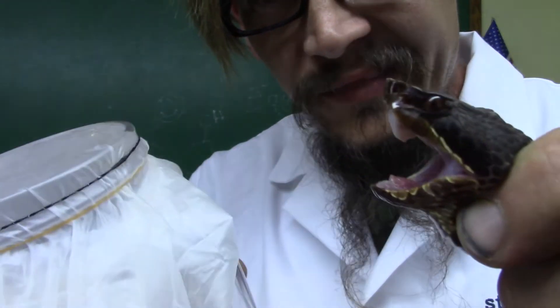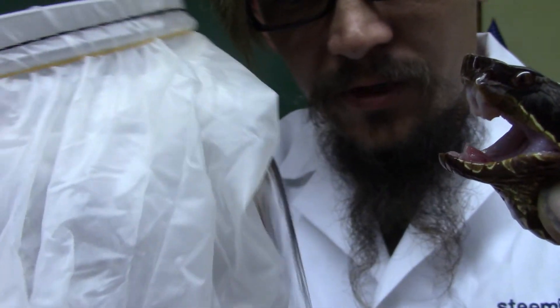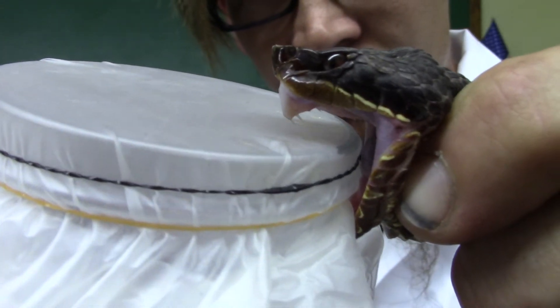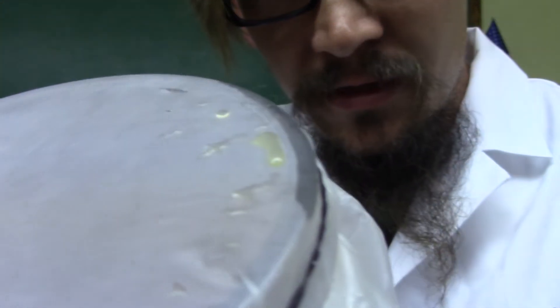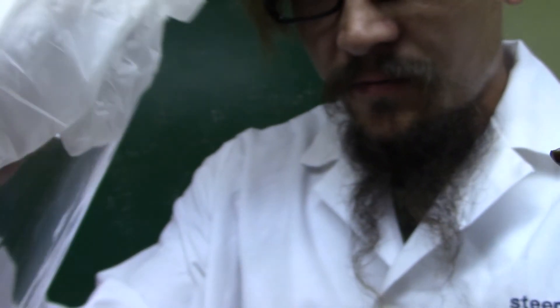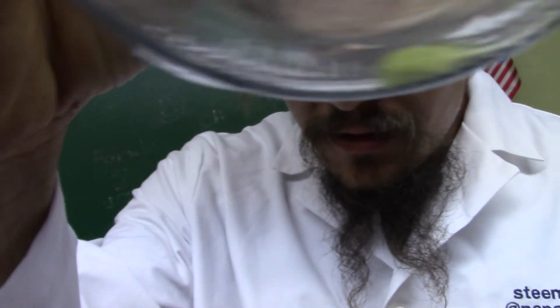Actually it was just about that easy. Vinyl glove, rubber band on the top of a jar, put it here — he helps. That one's still on top. Nice little bead, and then down at the bottom of there. I'm not sure if you guys can see that, but there's at least one little drop of venom.